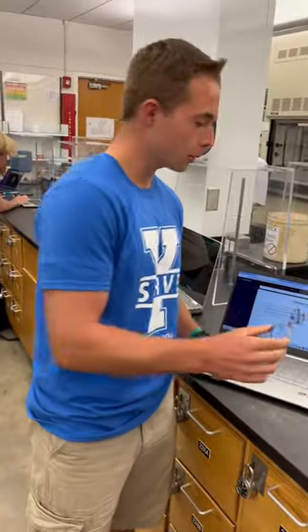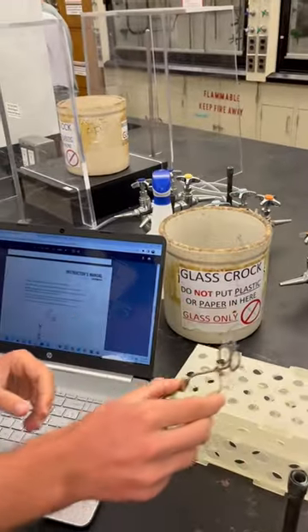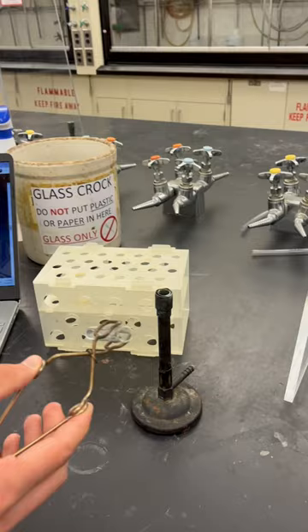Hi, I'm Trevor. I'm in section 15 in Aurora's Matier, and today I'm going to be showing you how to do the Bunsen burner. So take your little clamp screws, and then you're going to take your test tube sample, and then the Bunsen burner — we haven't plugged it in, but it will shoot out a flame right here.